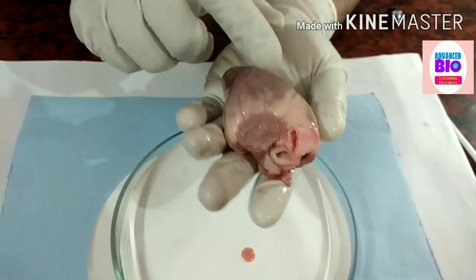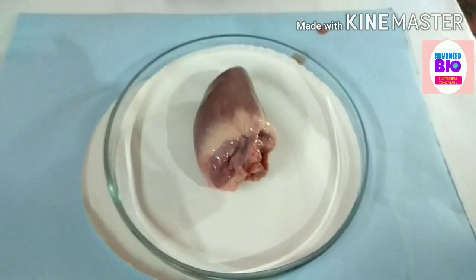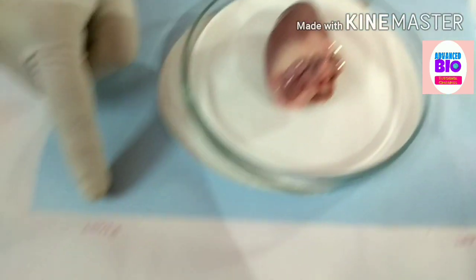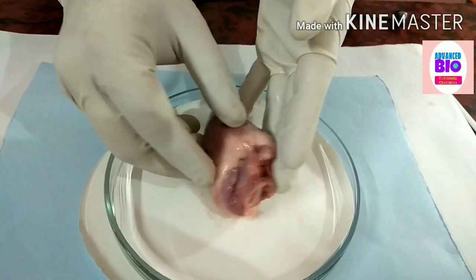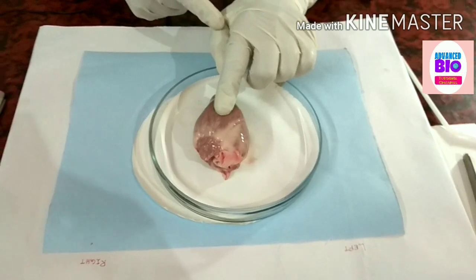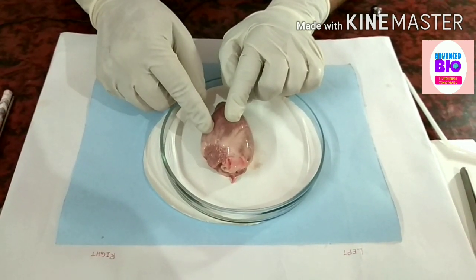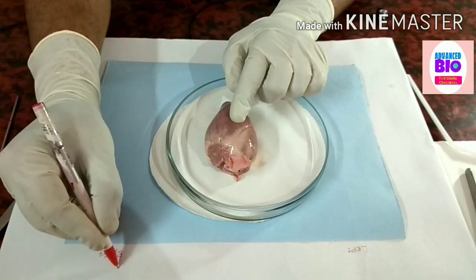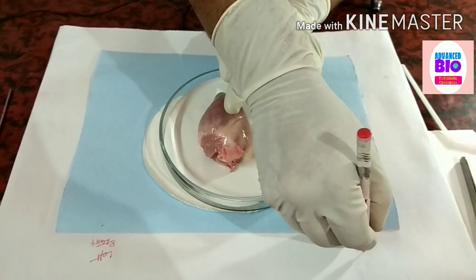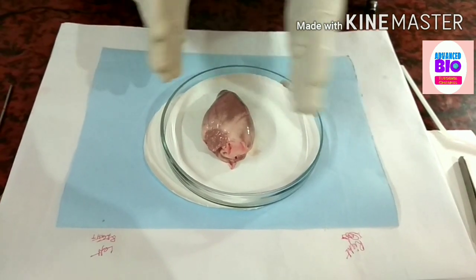This is the dorsal face of the heart and this is the ventral face of the heart. If we keep it dorsal side up, this is the left side of the heart and this is the right side. If I turn it upside down to the ventral side, then the sides are reversed — this side becomes the left side and this is the right side of the heart.